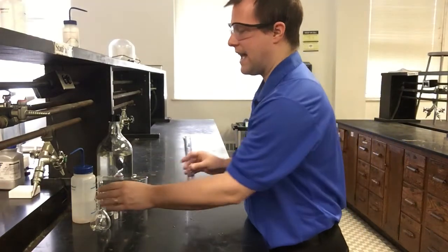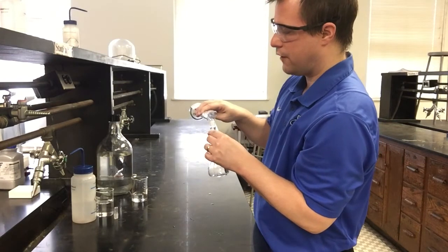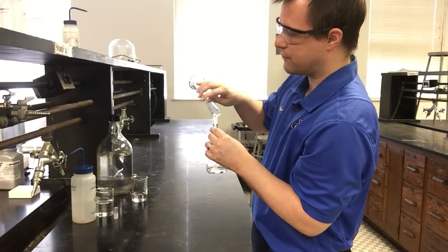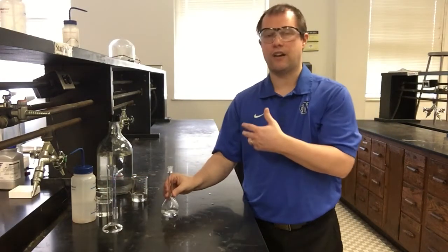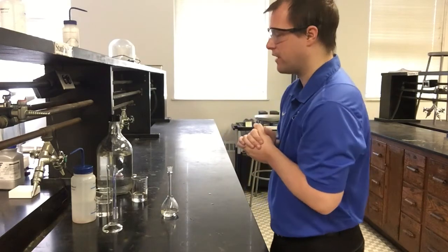And so I'm going to go ahead and add that stock solution now to my volumetric flask. If you're really careful with this, you probably don't need the volumetric flask for this particular portion of making our solution. You could measure out really accurately exactly 80 milliliters of deionized water to add to get to that 100 milliliters total. But the volumetric flask is usually the more accurate, safer way of prepping these solutions.